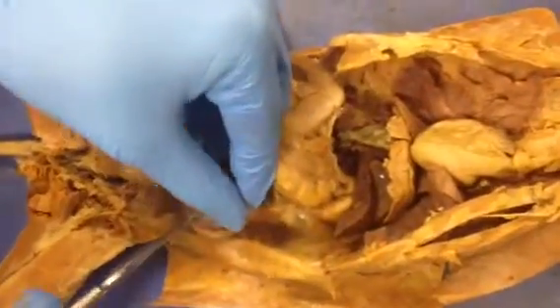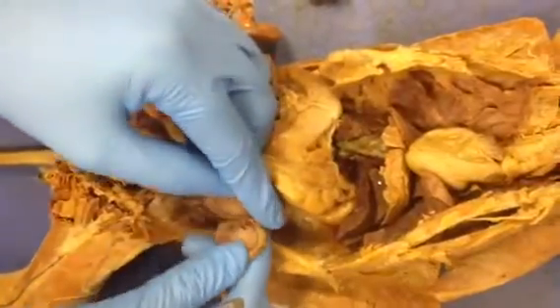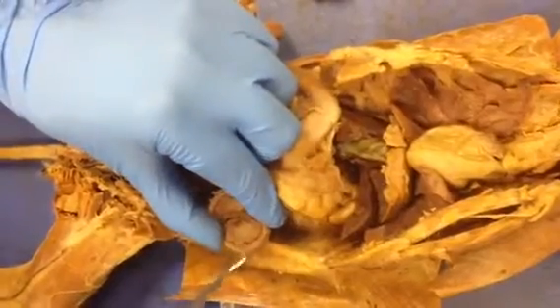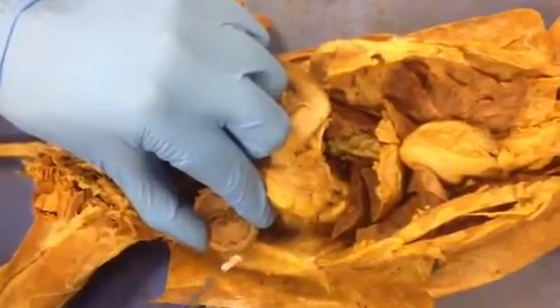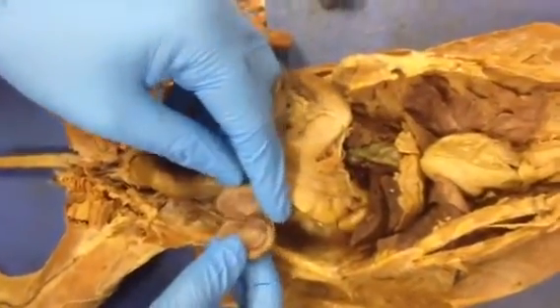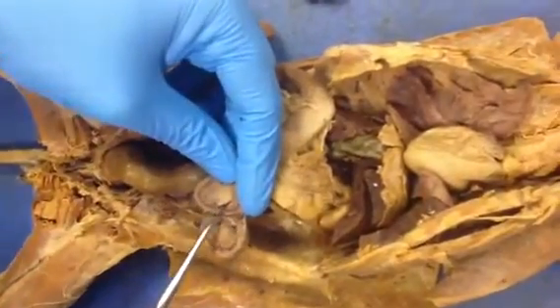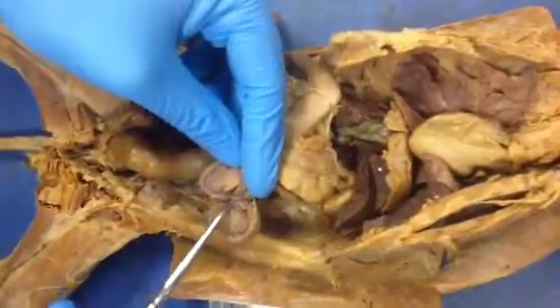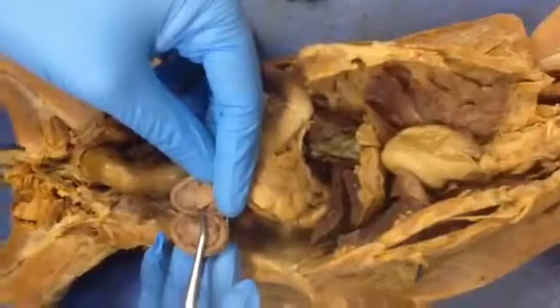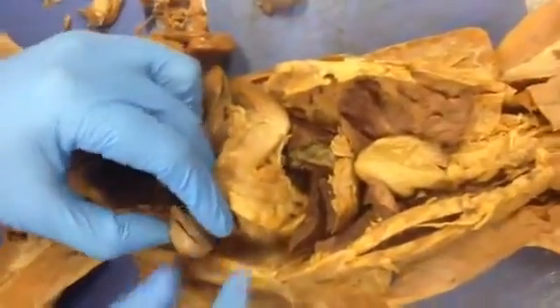Okay. So you can see the major and minor calyces. If you remove this, you might be able to see them, but it's too small to see in detail. In some of them, you can see very fine cortical radiate arteries and veins, but it's very hard to see them though. Here now, if you put your probe below, you continue with the renal pelvis, and you go down here. See the structure that I cut? You put this probe down in the middle, you will go into the ureter.